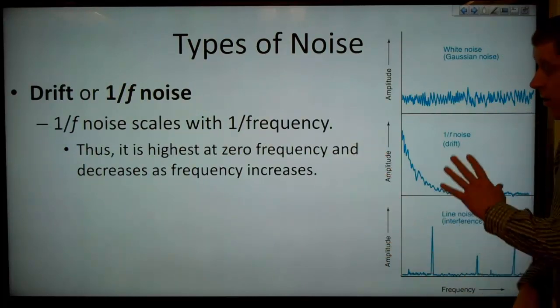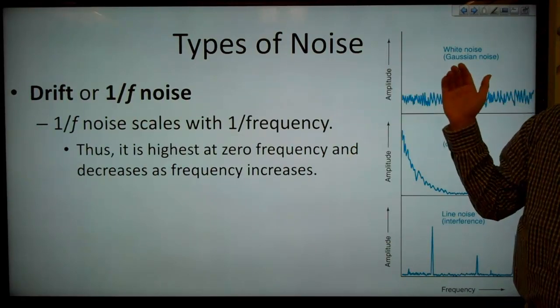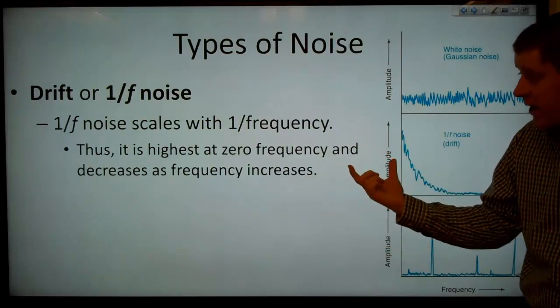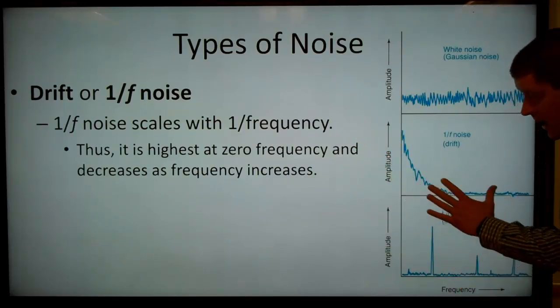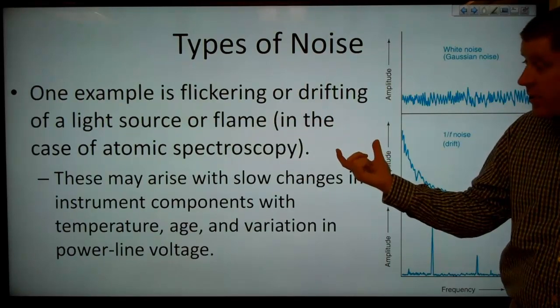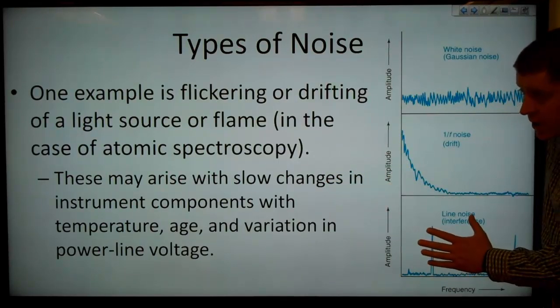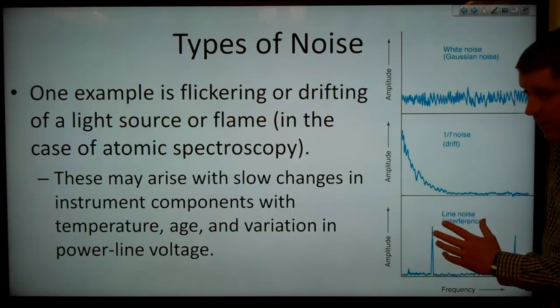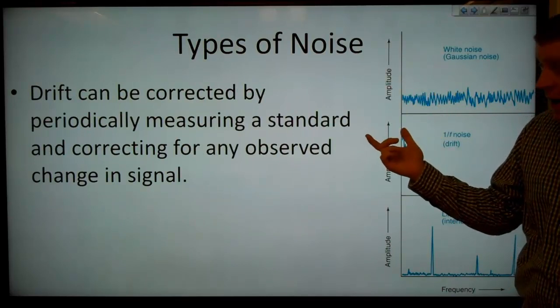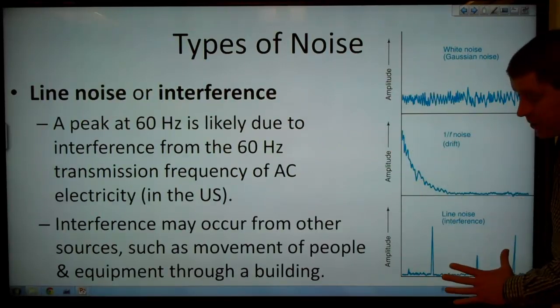The second type of noise here is drift, or 1/f noise. The 1/f noise scales with the inverse of frequency. That's where that f is coming from. So that means it's at its highest at 0 frequency, and is decreasing as frequency is increasing. One example of this is flickering or drifting of a light source or a flame, in the case of atomic spectroscopy. And these can arise with slow changes in instrument components with temperature, age, and variation in the power line voltage. Now, drift can often be corrected by periodically measuring the standard and correcting for any observed change in the signal. Our third type of noise is line noise, or interference, shown down here.